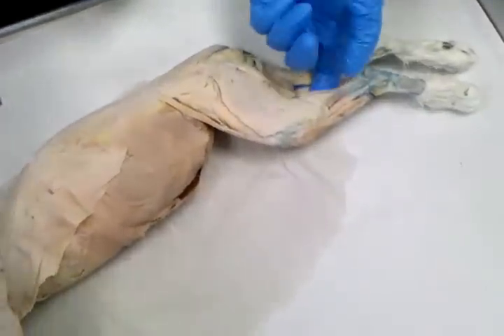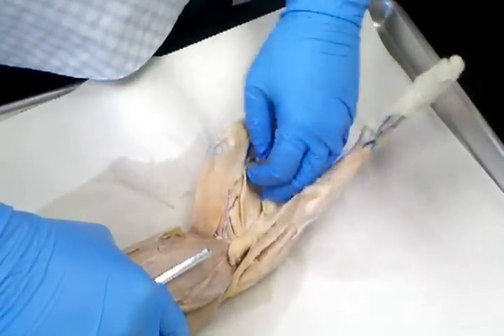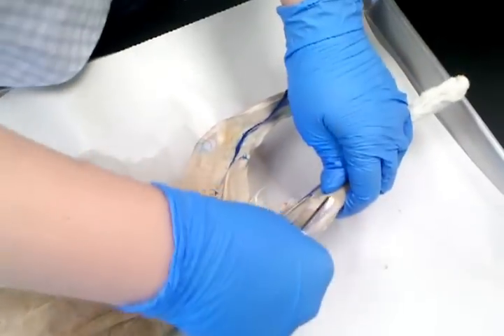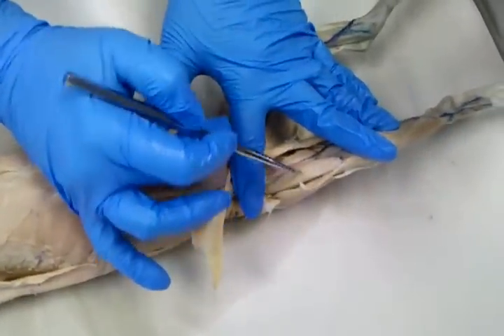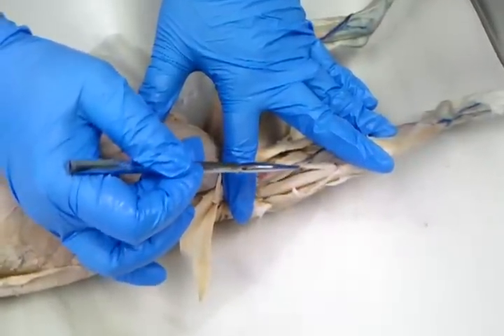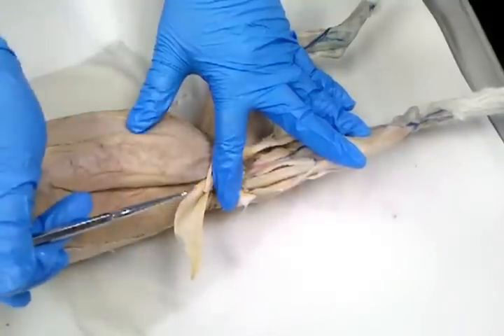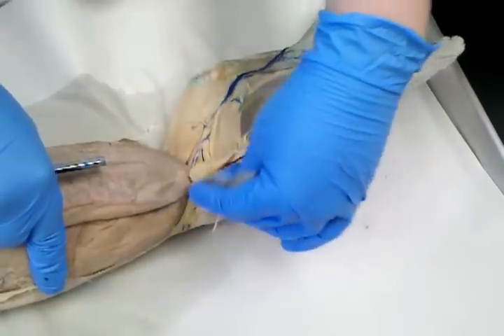Yep. Okay, inside of the leg. So you've got two large superficial muscles. You've got the sartorius on the top and the gracilis on the bottom. Okay, if you flip back the sartorius, deep to the sartorius, this little hot dog looking muscle, these are the quadriceps. Okay, so the little bun part of the hot dog are the vastus muscles. The outside is vastus lateralis. The inside is vastus medialis. So the actual hot dog part is rectus femoris. Okay? And so those three together make up the quadriceps.